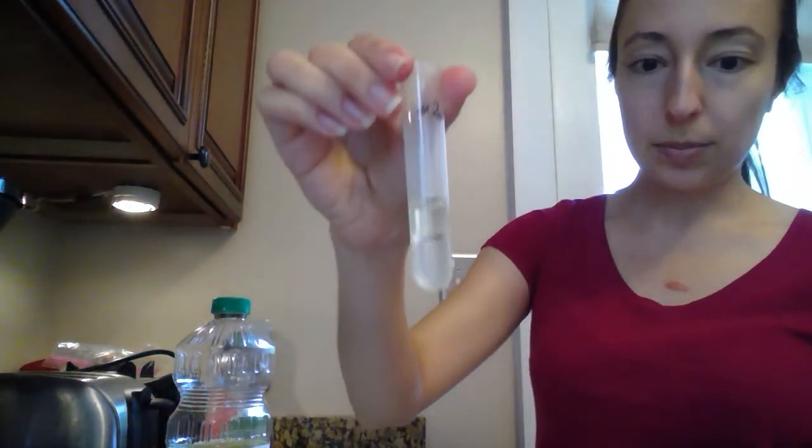Okay. So it should look something like this. Right? And again, you can cap them, you can put them in a container and just kind of let them sit and do their thing. Okay.